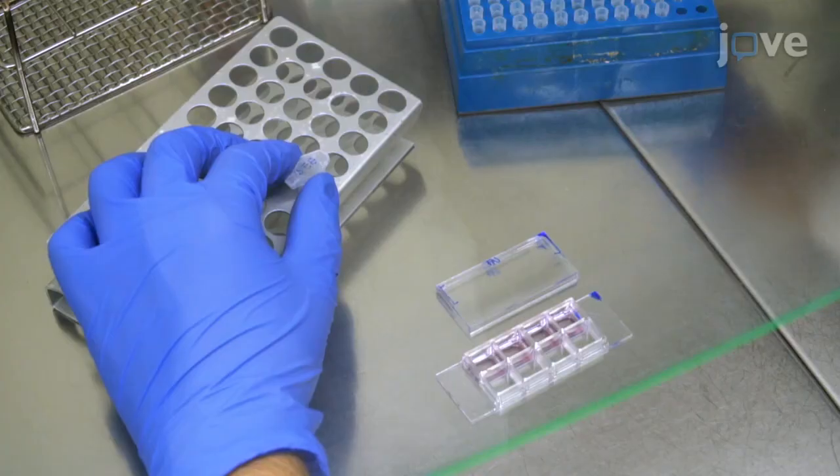Reductionist experimental models exist that may simplify imaging in the immune synapse, but these models do not emulate the complex and irregular surface of the antigen presenter cells that may produce non-physiological interactions at the immune synapse. The approach described here is suitable to reproduce and confront some biological complexities occurring at the immune synapse.